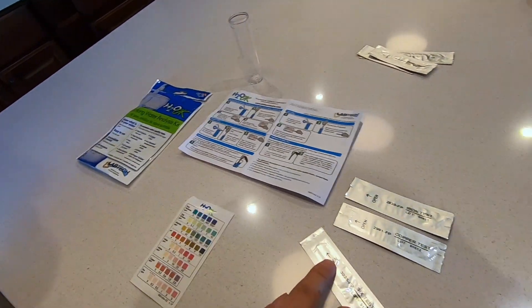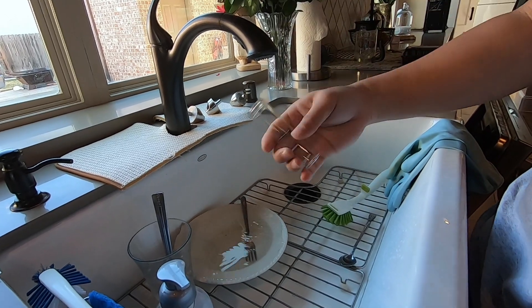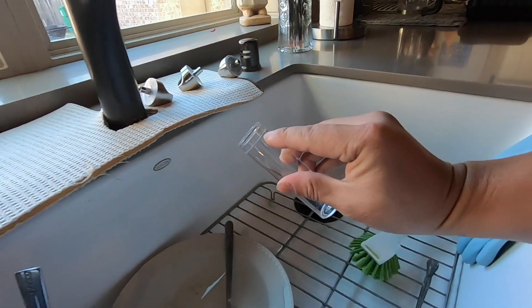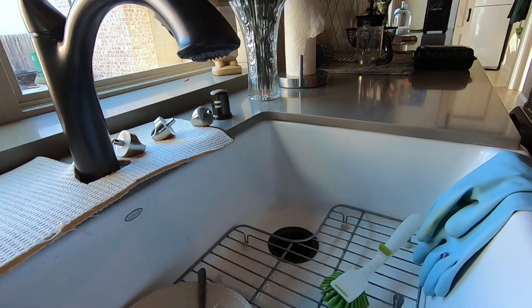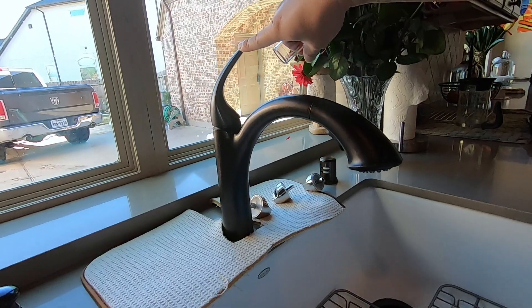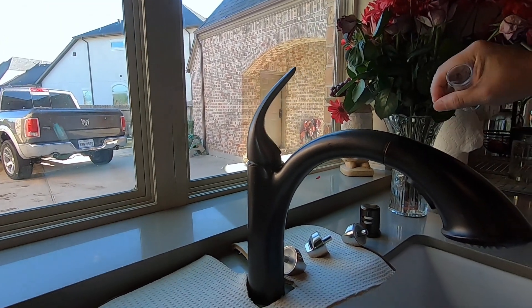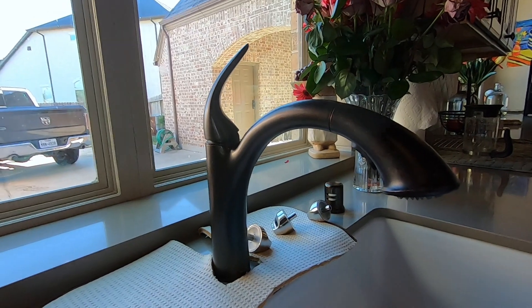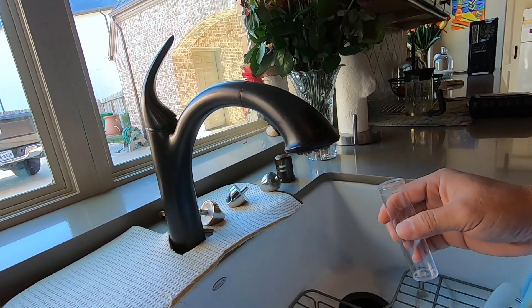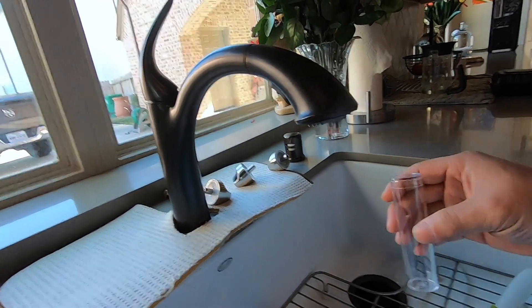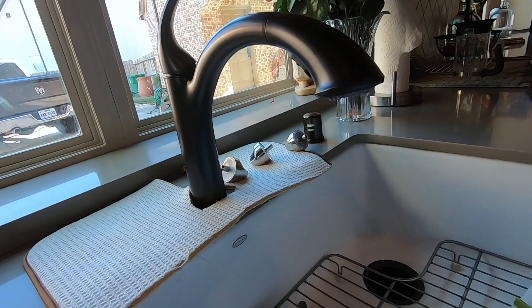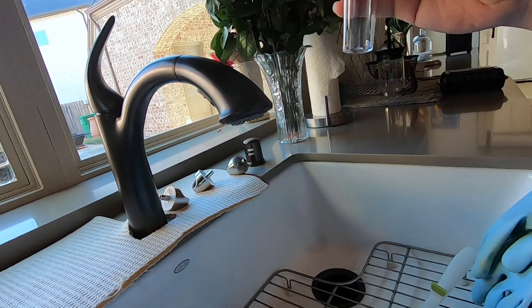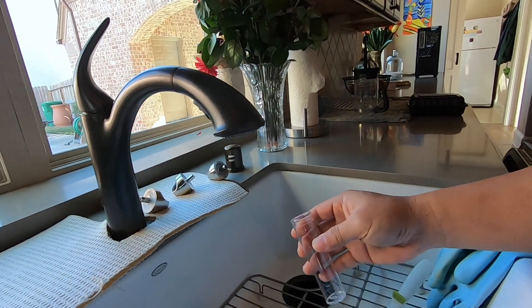I'm going to fill the test tube all the way to the edge line here. When you do this, make sure that your water line or supply is switched to the right, usually to the cold water. You want to make sure you're not getting any water from your water heater which may have sediments and other things in the tank. You want to get the purest source of your water which is cold water.